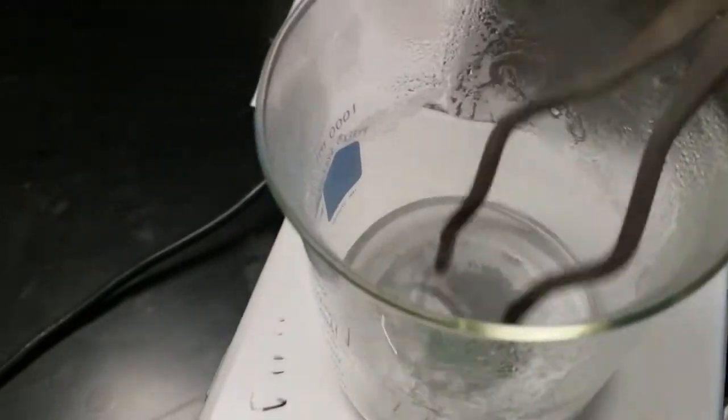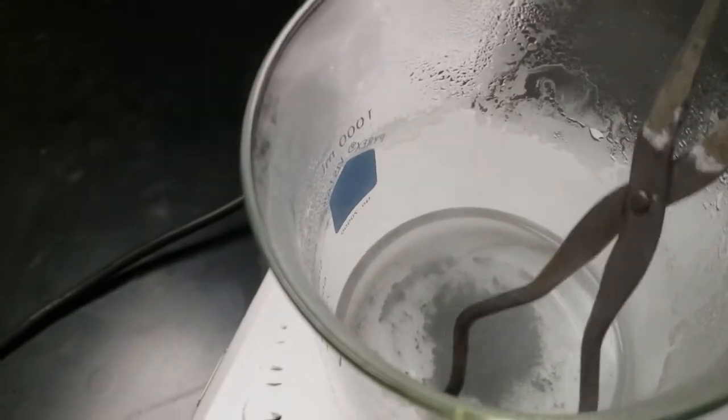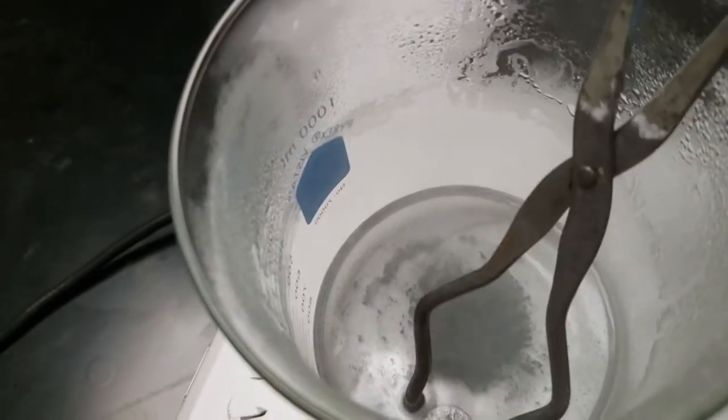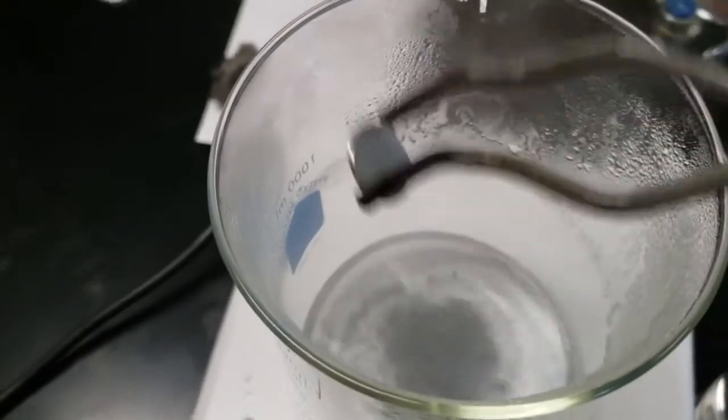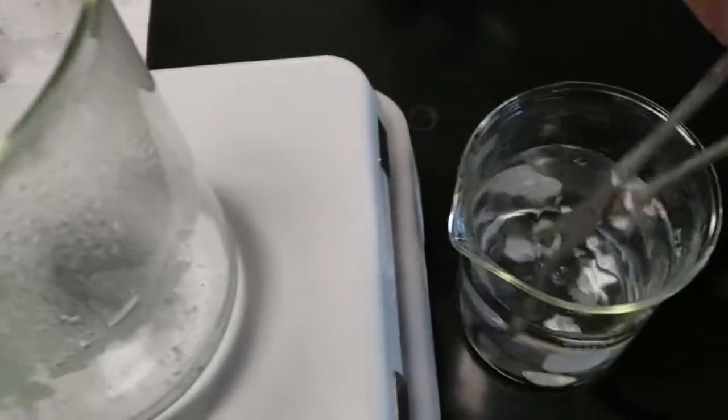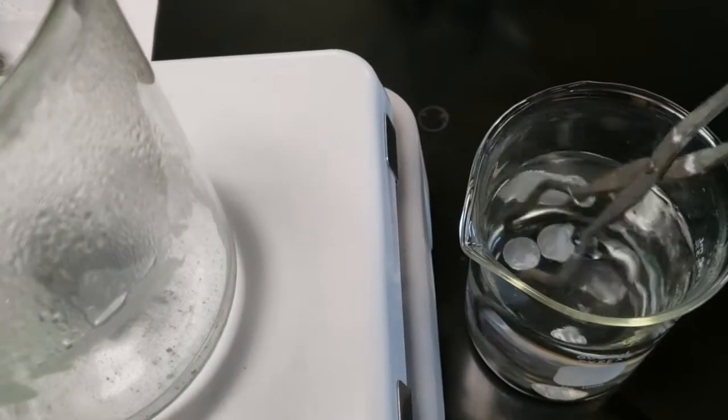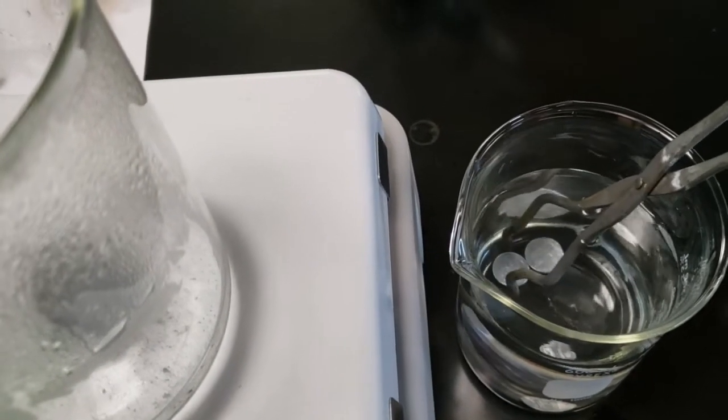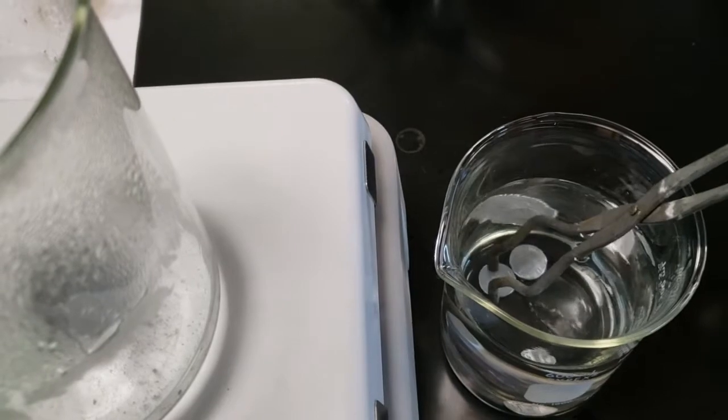We're going from a very concentrated heated sodium hydroxide here to dilute it a whole lot here. We're gonna shake it off a little bit. We want to get as much of the zinc particles off of it. We want to get as much of the sodium hydroxide off of it, so we're gonna swirl it around a little bit.